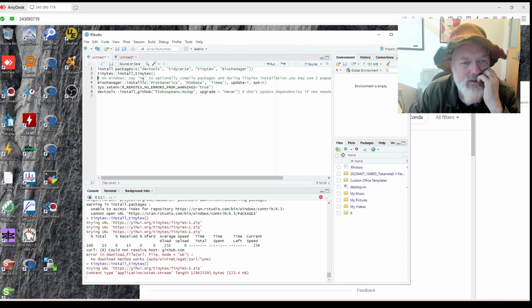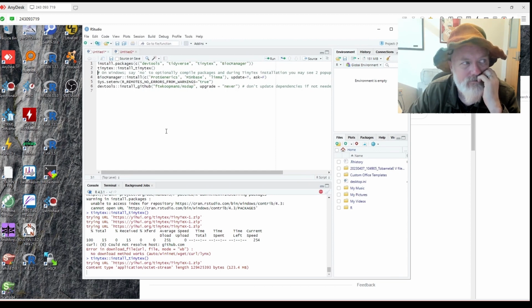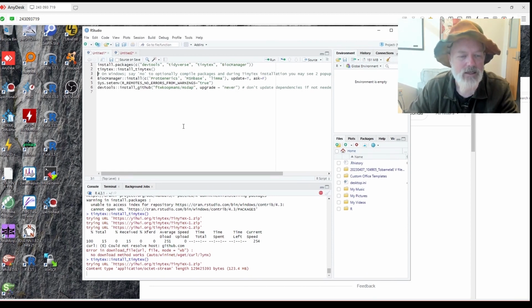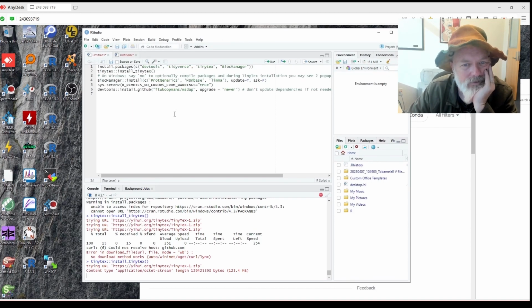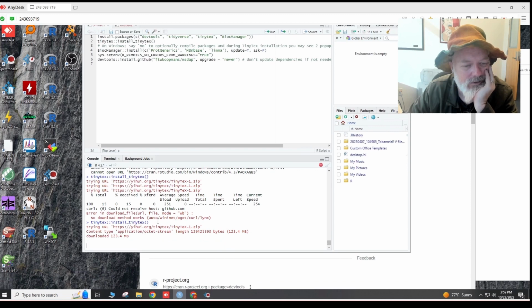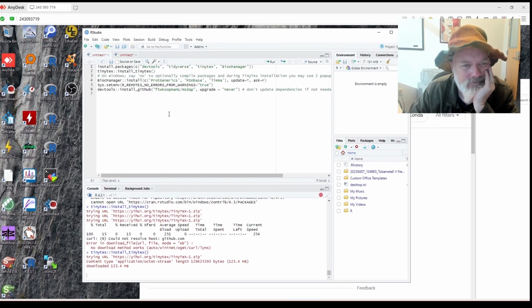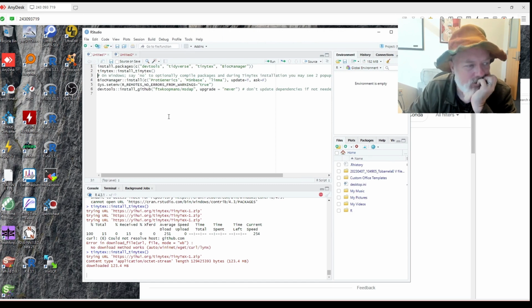They have really good help in here. Okay. All right. We have RTools installed. Okay, is it working? Is it working? All right, it downloaded. Woohoo! All right, let's see. Okay. Come on, come on. This always takes so long.